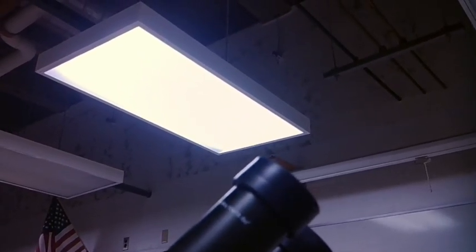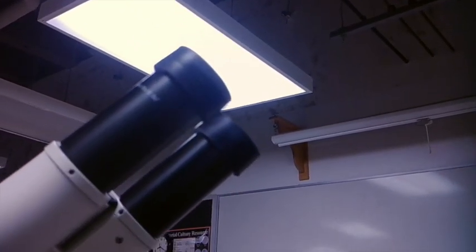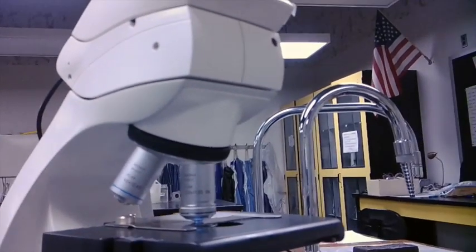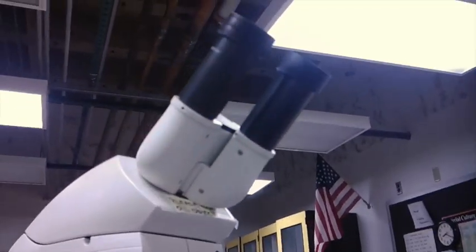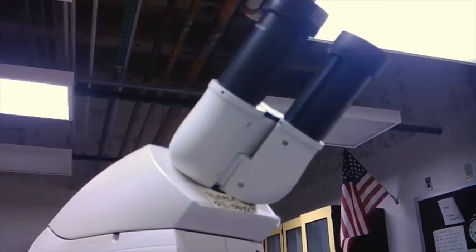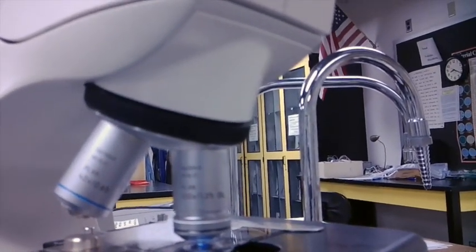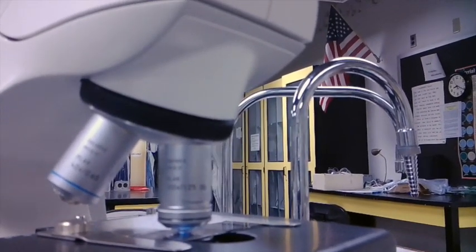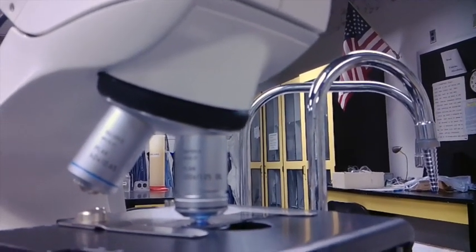So when looking at this, we need to consider we have two objectives on our microscope. We have our ocular, our eyepiece objective, and then we also have the objective that's in the microscope itself. So the reason I say in the microscope is you can always change out your ocular objectives. So with this, you have an ocular or eyepiece that has a certain magnification. For purposes of this video, our objective is 10x for our ocular lens.